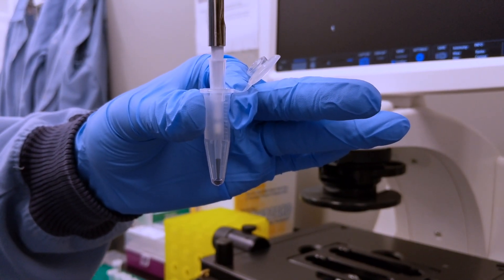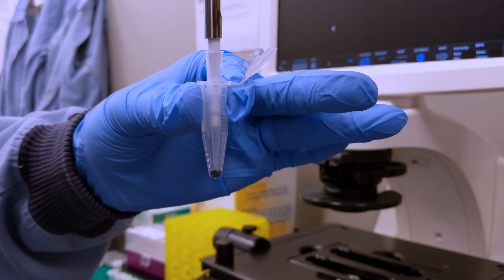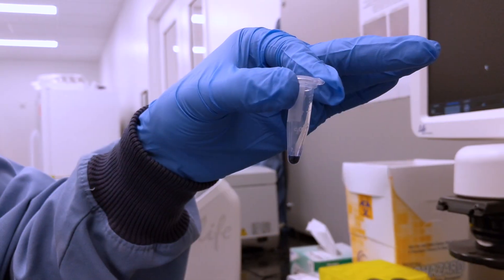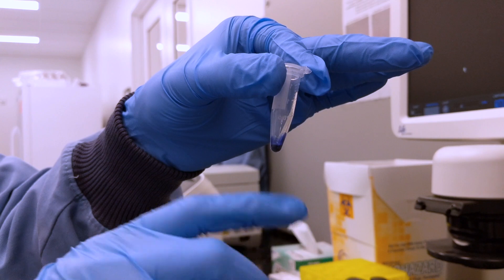Trypan Blue is a reagent that distinguishes living cells from dead ones because it can cross the membrane of dead cells and stain them blue.